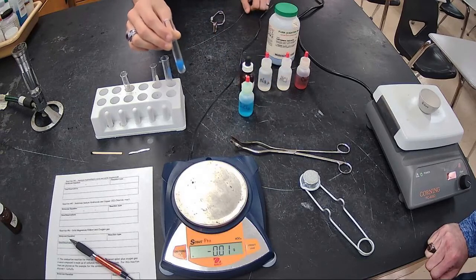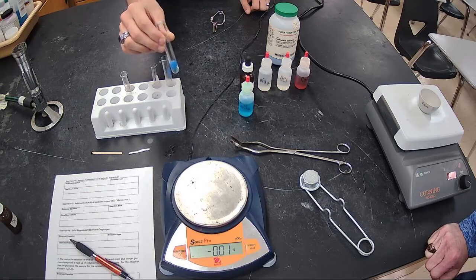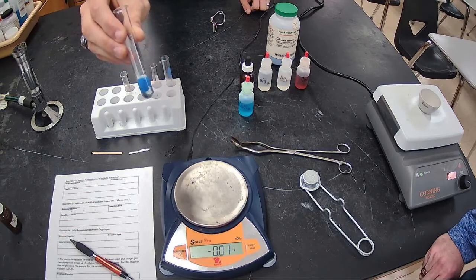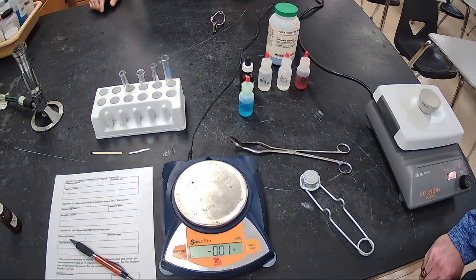Yes? So that product, you'll have to figure out what is that solid product, what are the aqueous ions that are left over as their spectators, right? And then what is the overall product there, and make sure you balance it. So write the overall equation for that. So we finished reactions 1, 2, 3, 4, and 5.